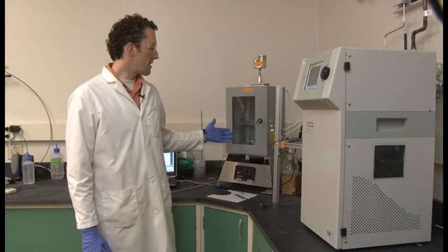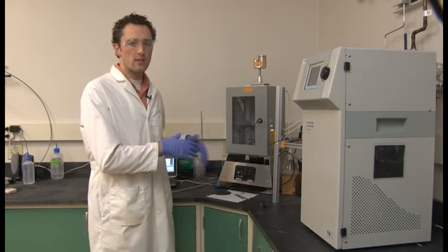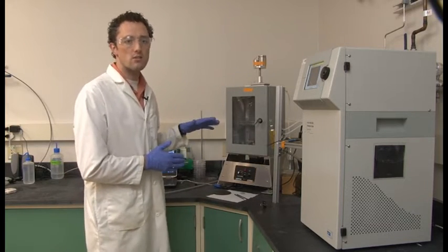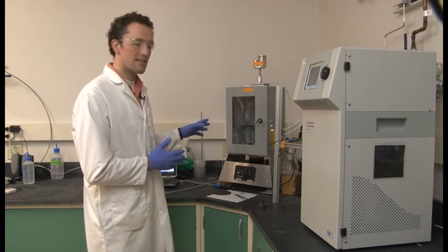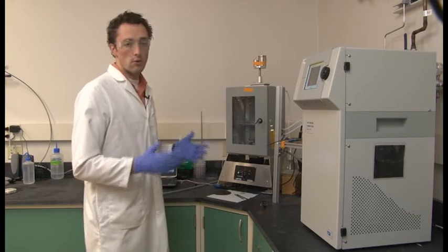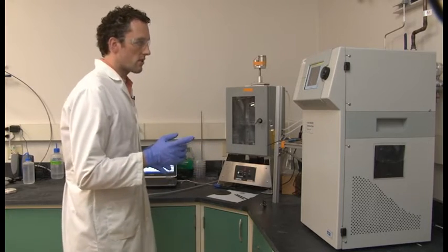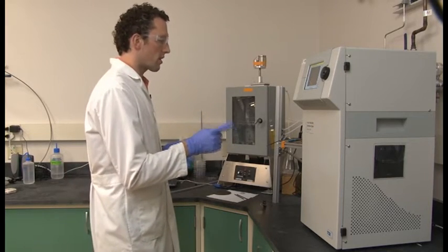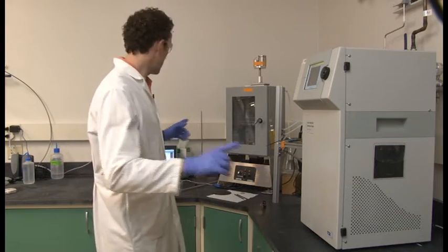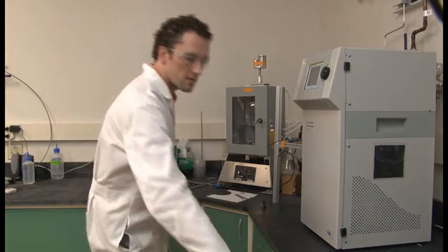So once the sample has been in the chamber and it's been allowed to equilibrate, I usually monitor the condensation particle counter when it gets down to baseline, which for our chamber is, like I said, usually under 5 particle counts per cubic centimeter. Then we're ready to start the test. So I try to start the fast mobility particle sizer and the condensation particle counter software simultaneously, which are on these two laptops.